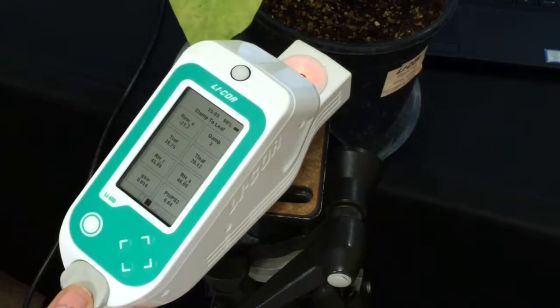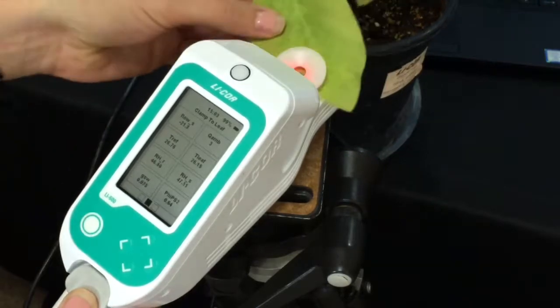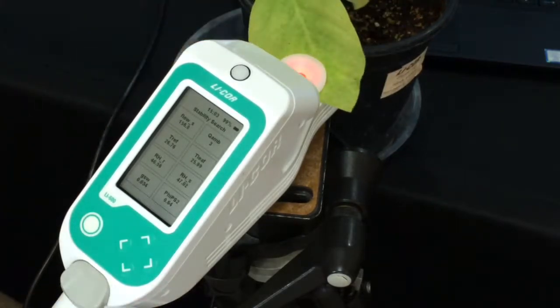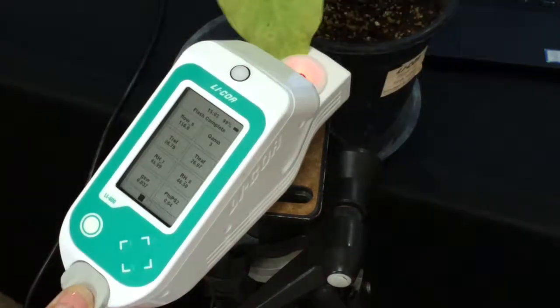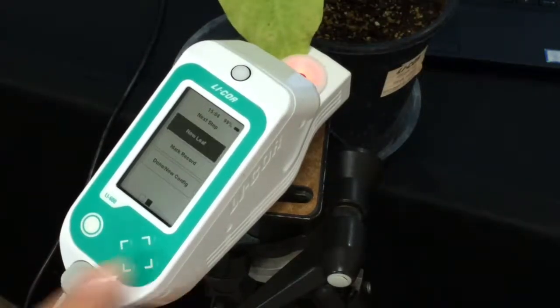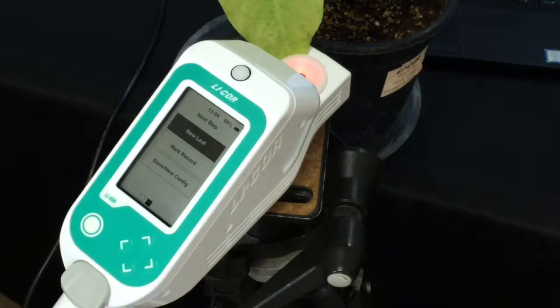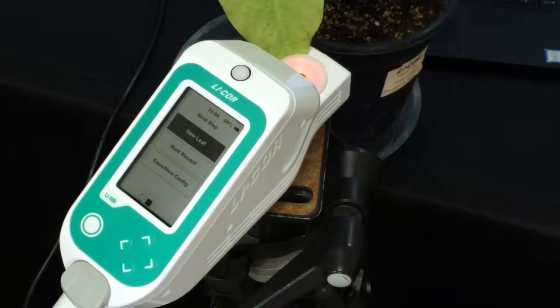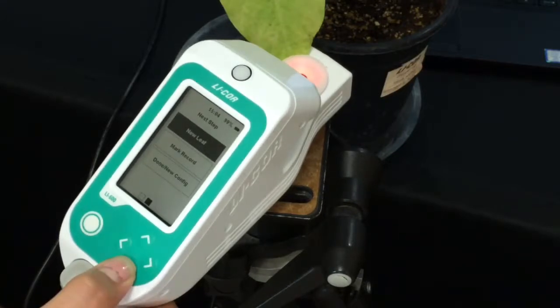We'll do that one more time, clamp onto a leaf. And then we're done. So now we've gone through these rapid measurements. And if at any time you want to change that barcode, you can always access it from the clamp to leaf screen.